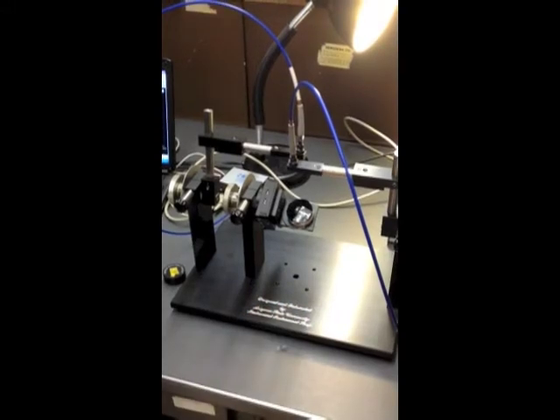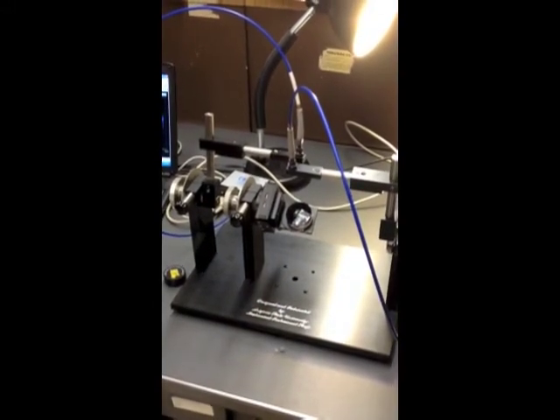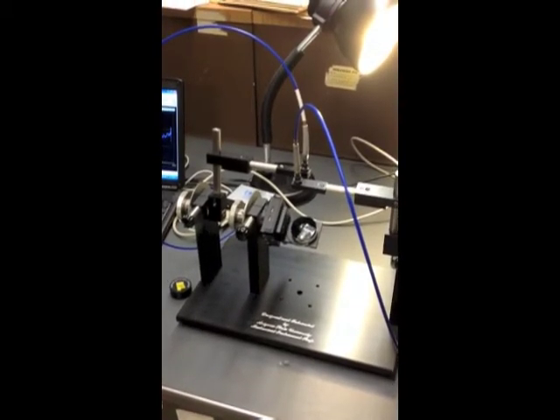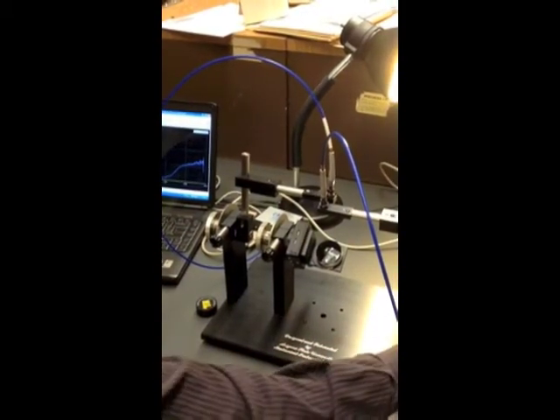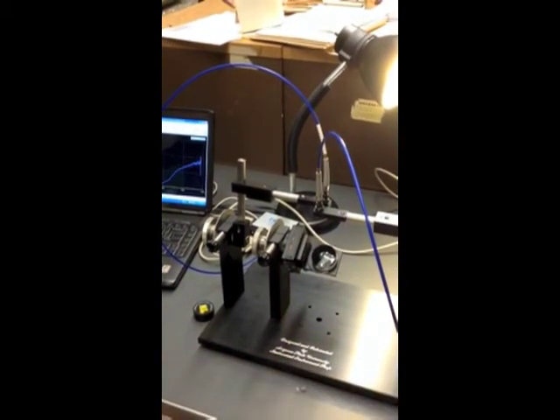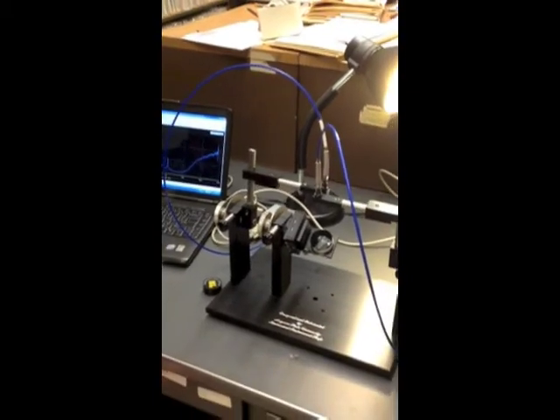Once it's fixed onto the stage, we can change the stage angle, and so that's the angle at which we're looking at the feathers. But also the advantage of the goniometer is that we can change the angle of both the spectrophotometer and the angle of the light source. Interesting. And so the idea here is that if we change the angle of the spectrophotometer and the angle of the light at the same time, we're getting specular reflectance, so that's the equivalent of shining light on a mirror. So that's a light that bounces directly back at you.